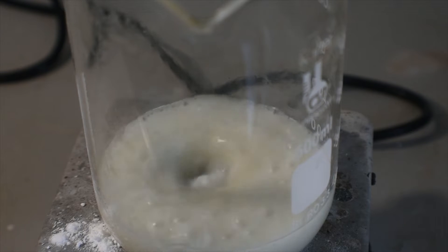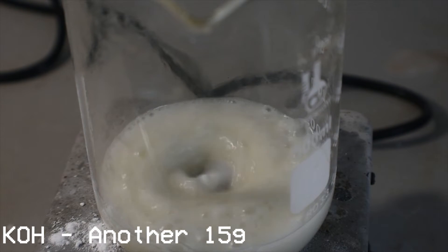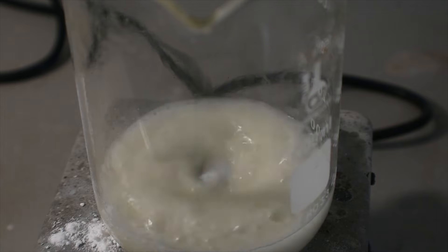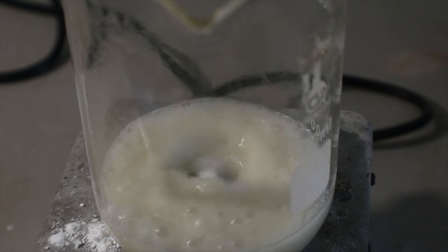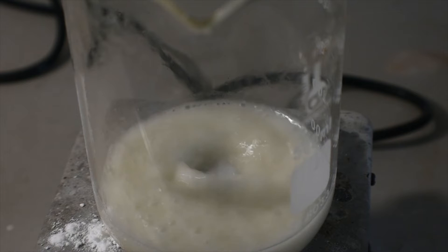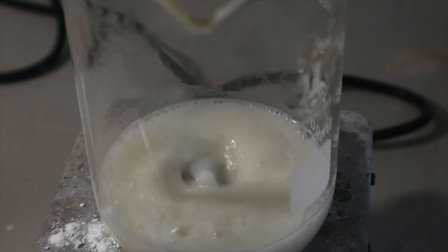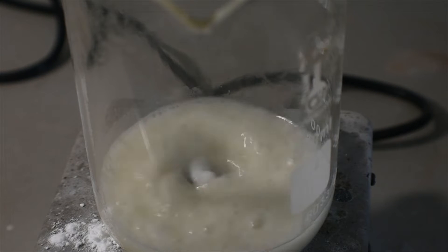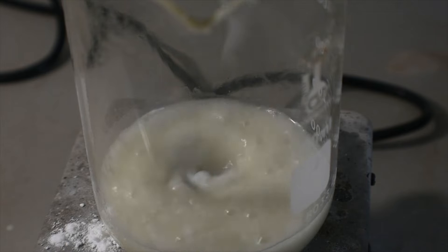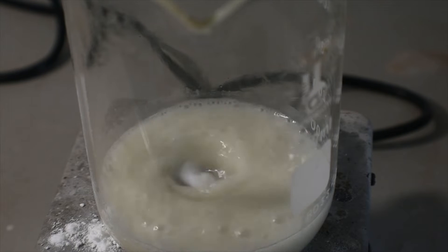Now I'm going to add a further 15 grams of solid potassium hydroxide very, very slowly to this solution — or rather mixture. As you can see, the dissolution of the potassium hydroxide is extremely violent due to the exotherm produced. So of course, do this very slowly.